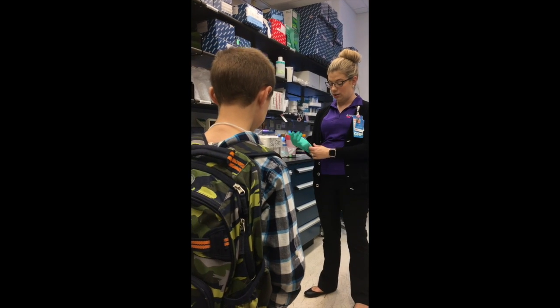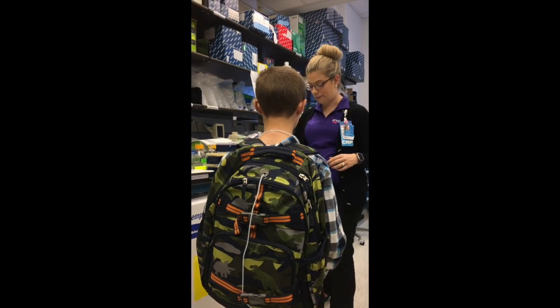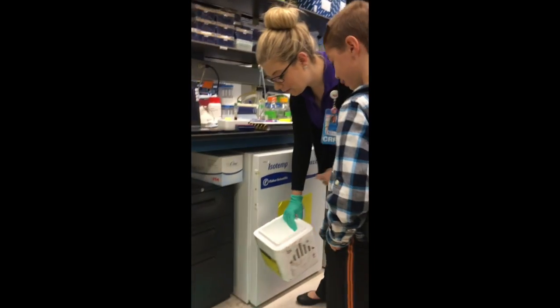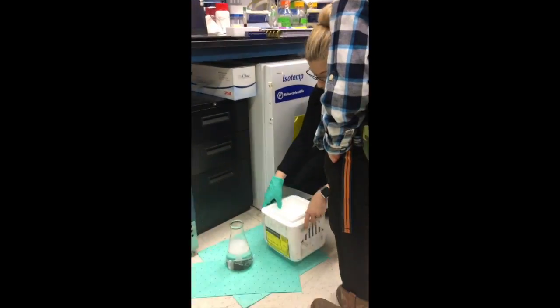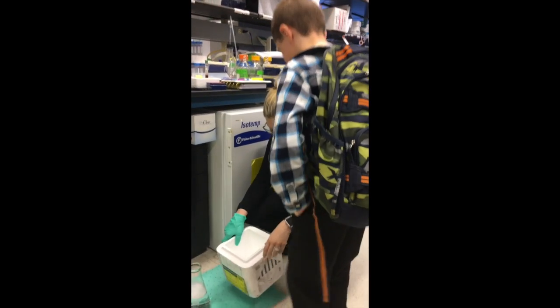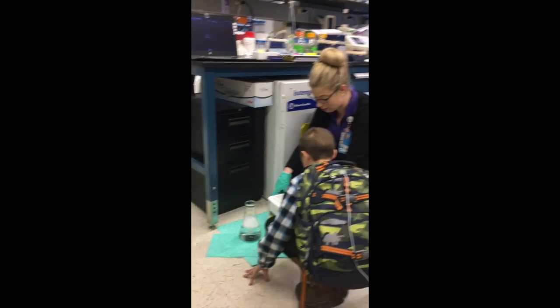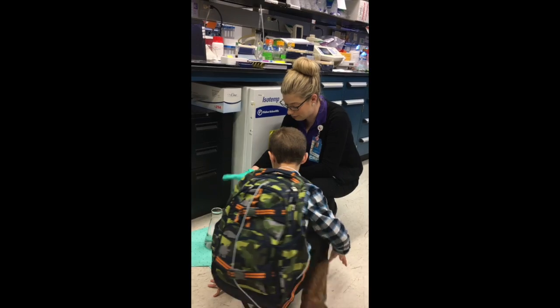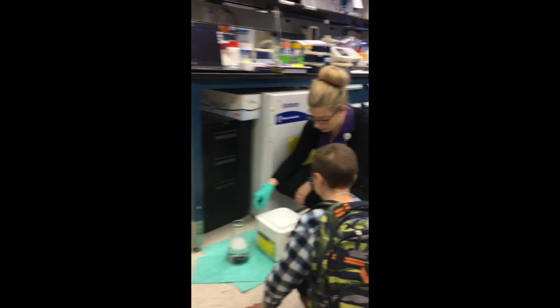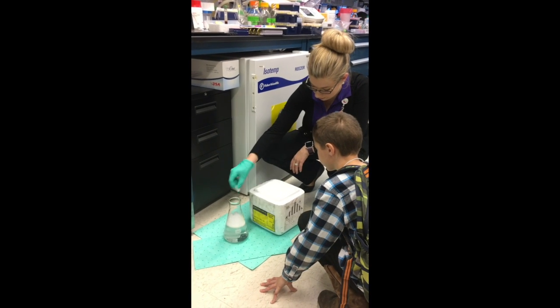That's terrible. Yeah, all right, we're going to have a little bit of fun here. Come on down here. What's with the ice? This is dry ice. Do you know what dry ice is? Do you see the pellets? Those are actual dry ice. You can't touch them. They're very cold. They'll burn you. They're so cold that they would actually burn you. That's why I'm wearing a glove. But we're going to see something happen when I put it in the water.